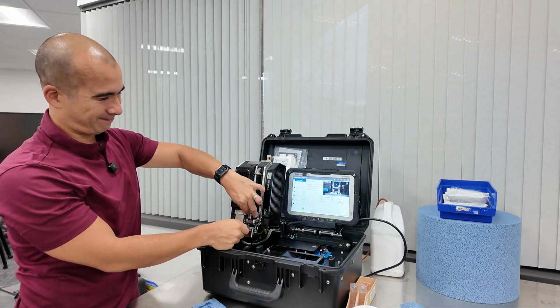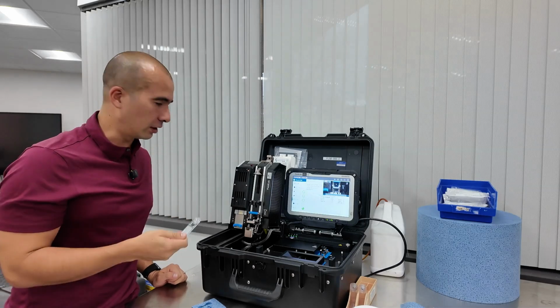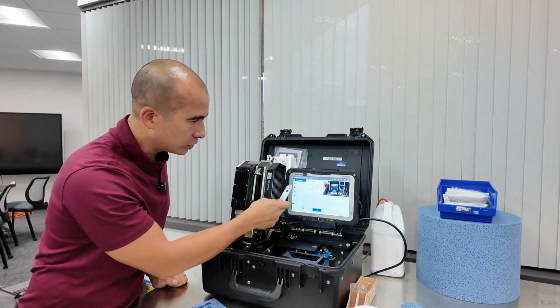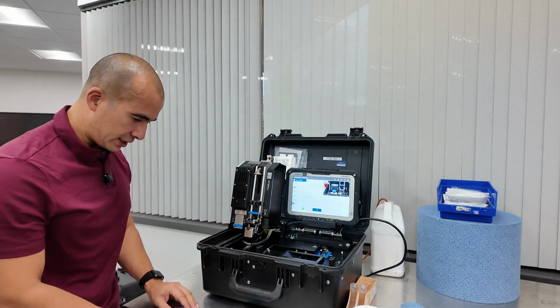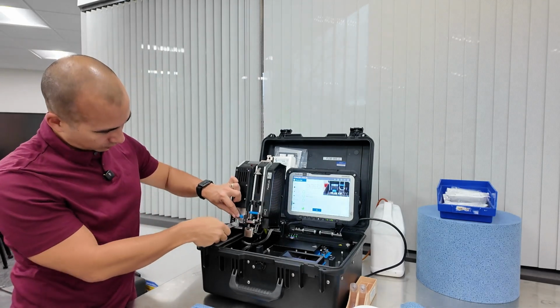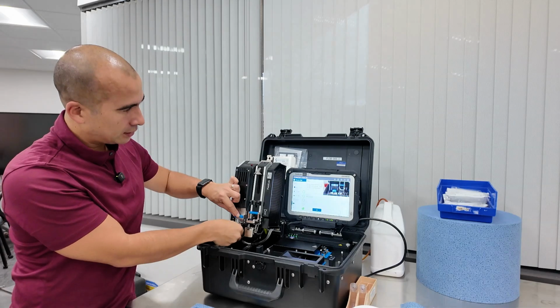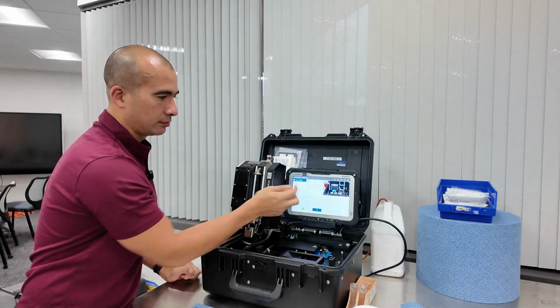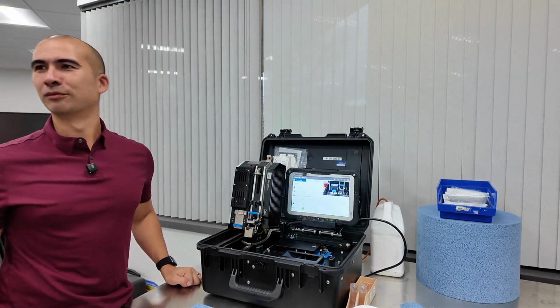So we can pull this out. Obviously, because it's gone through the drying cycle, it's not covered in oil. And the next step is elements, right? Which again, we're just stepping through the process. Now, ensure the bottom of the filtergram is clean, which it already is because of the drying, but we'll just wipe it off a little bit here. Insert it into the module, which is back in the same place that we did the zeroing earlier. Okay, and then I close it, then press start. All right, and now we wait.